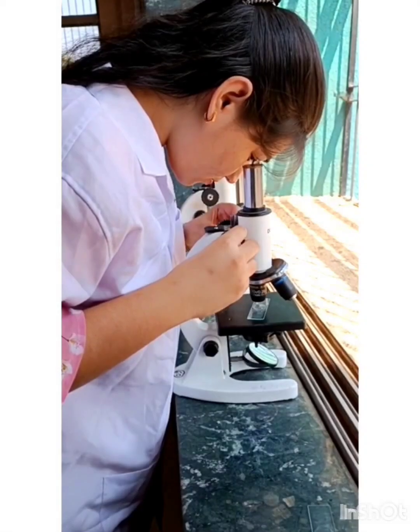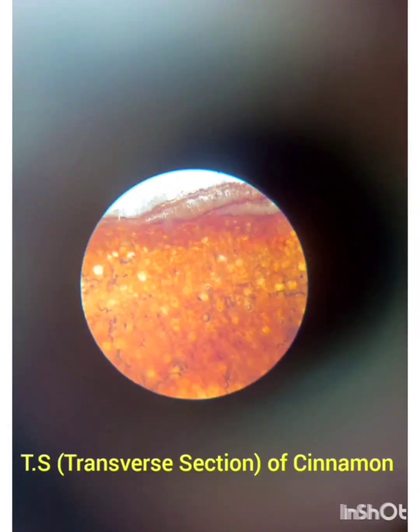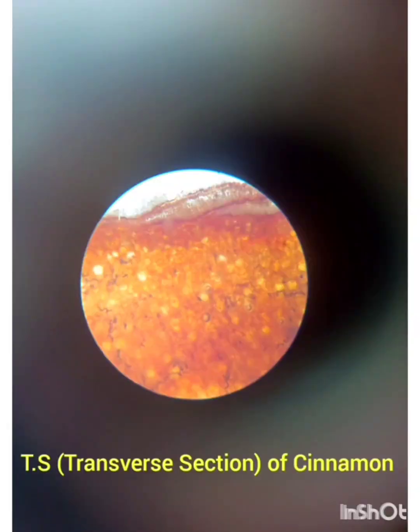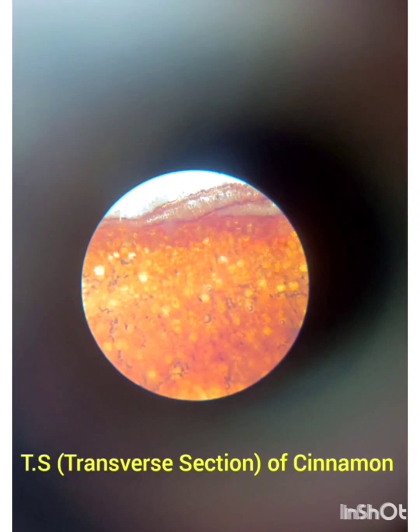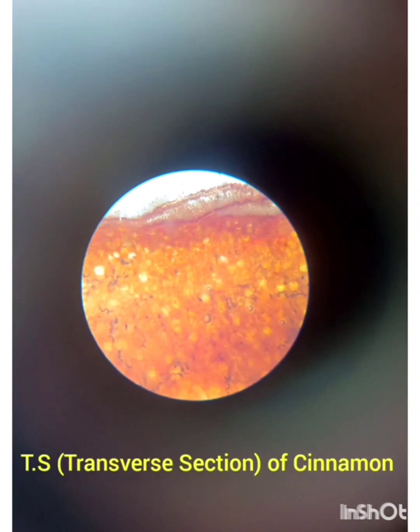This is the transverse section of cinnamon bark which we observe under the microscope under the 10x objective.